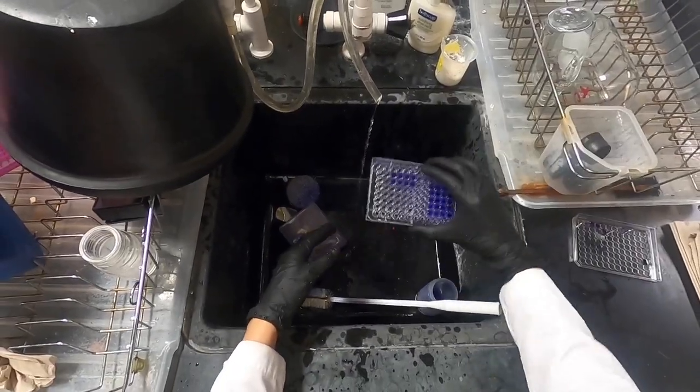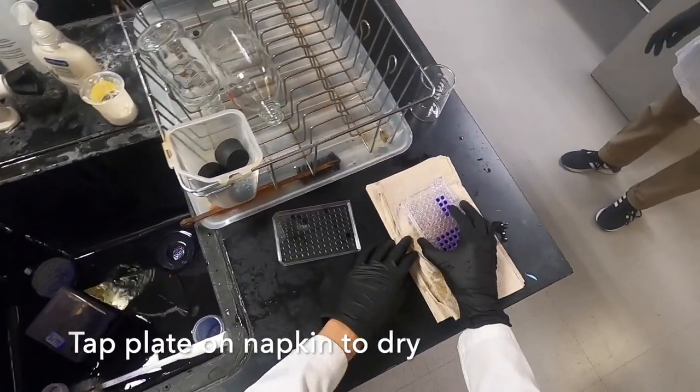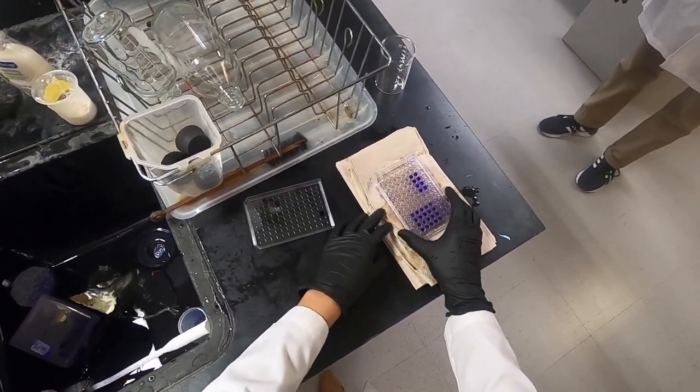Then we will dry our plate by inverting it onto a paper napkin and tapping it a few times in order to remove the excess water.